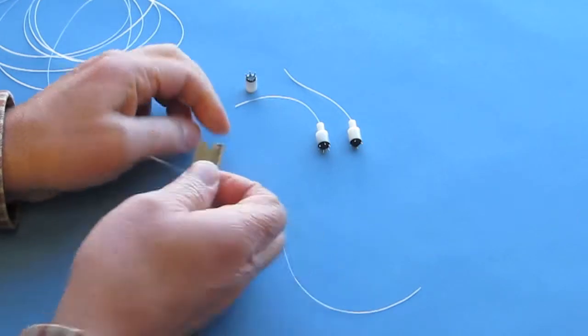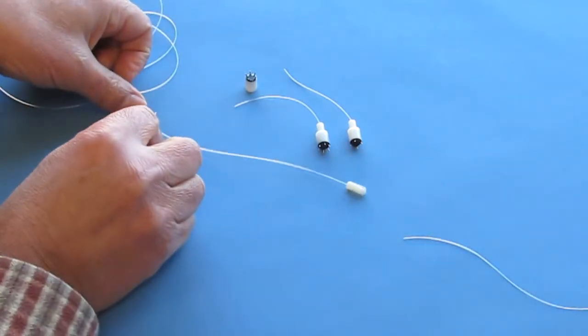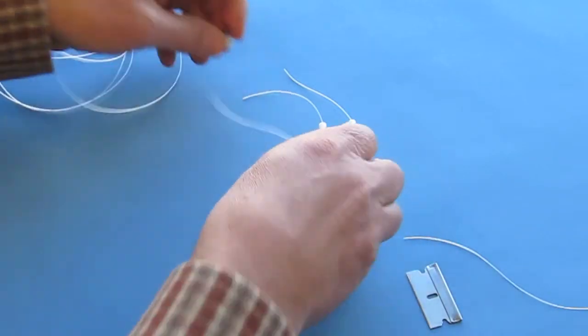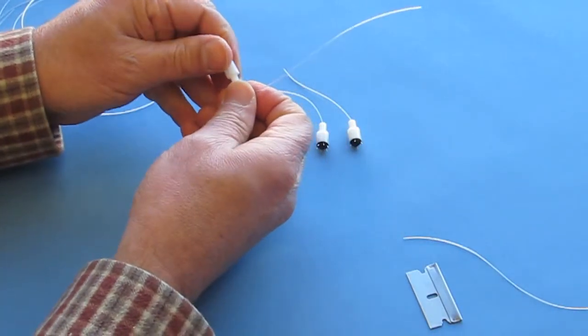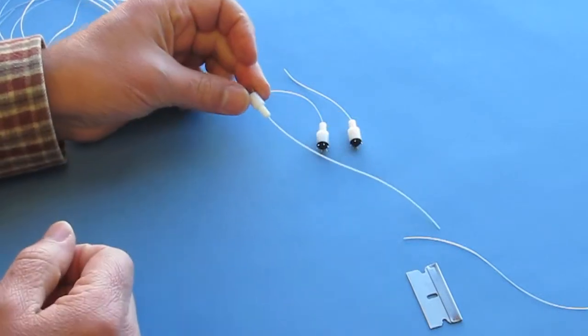Once you have inserted the tubing into the tail, pull it through until the tubing is back up to its original diameter, then cut it flush on the input side and trim it to a good working length on the output side, about 3 to 4 inches.